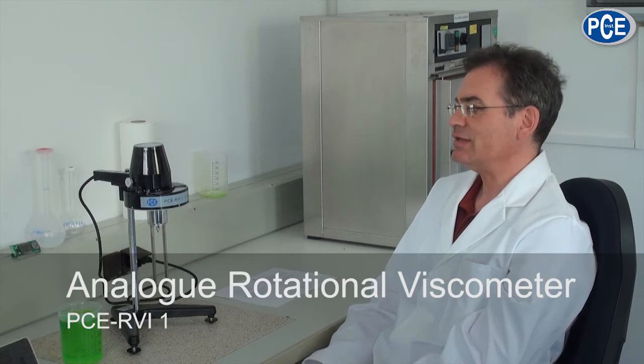This measuring device serves to determine the viscosity of a fluid. The viscosity is a physical size and with this measuring device I can change the physical size into a measured value.